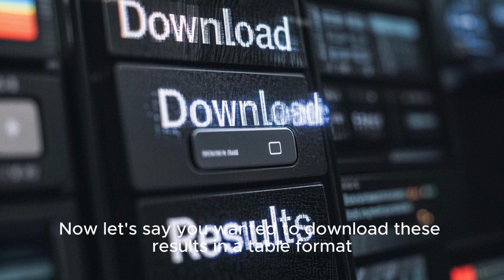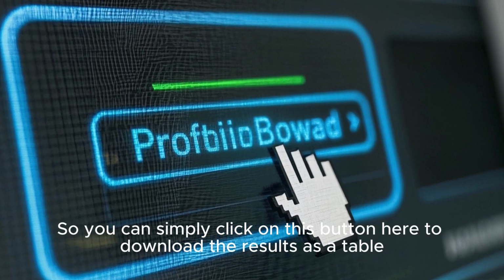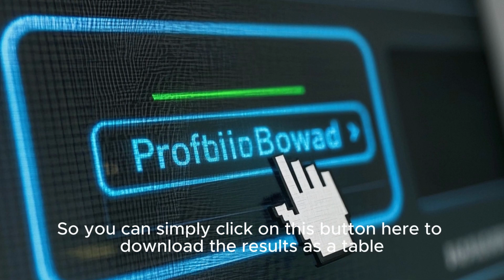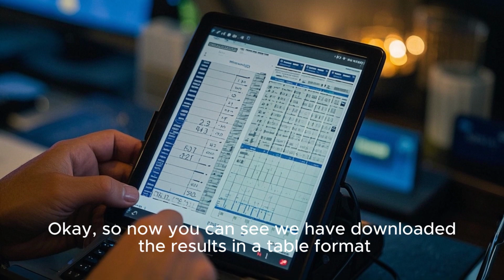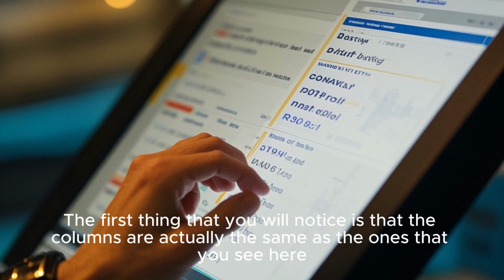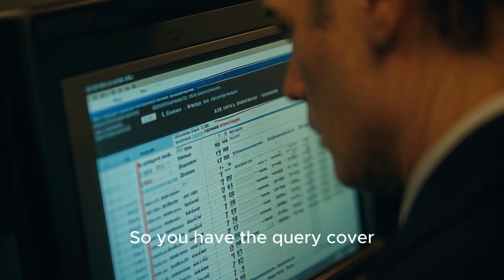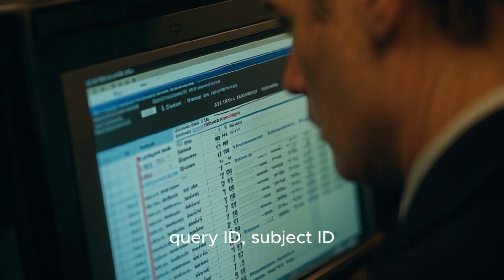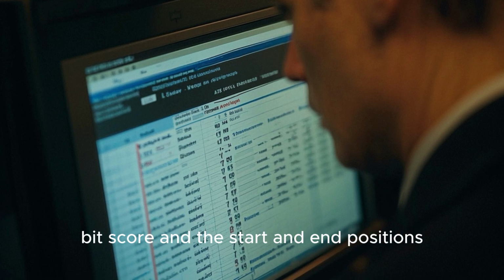Now let's say you wanted to download these results in a table format, so you can simply click on this button here to download the results as a table. Okay, so now you can see we have downloaded the results in a table format. The first thing that you will notice is that the columns are actually the same as the ones that you see here. So you have the query cover, query ID, subject ID, percent identity, E value, length, bit score, and the start and end positions.